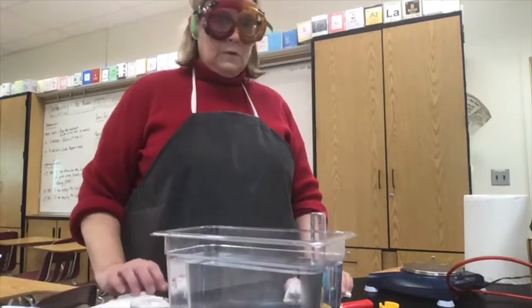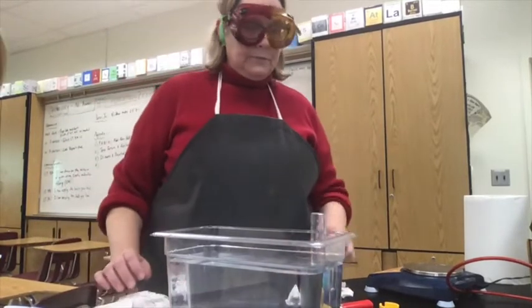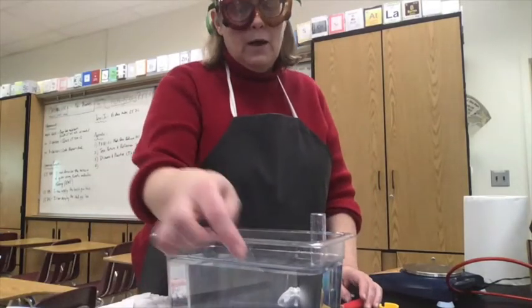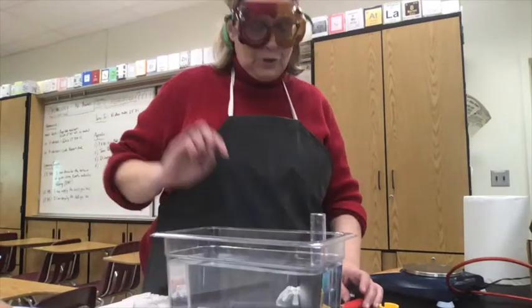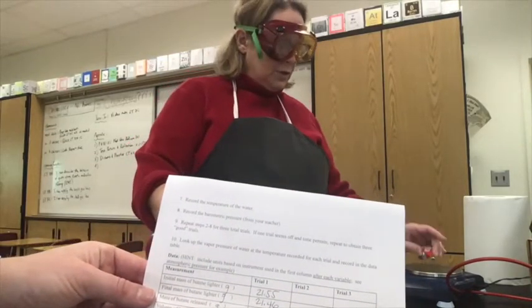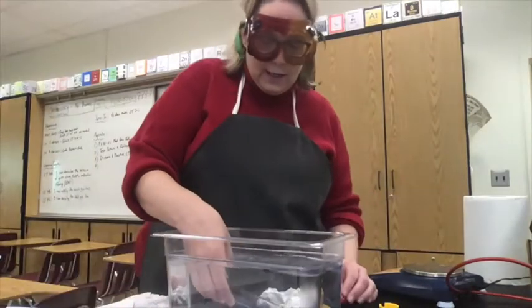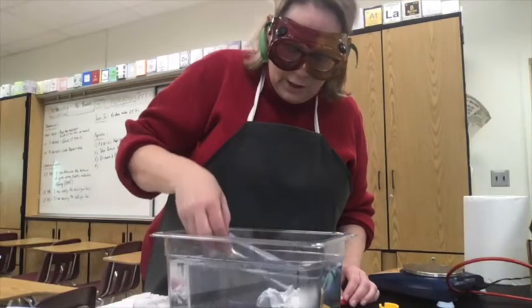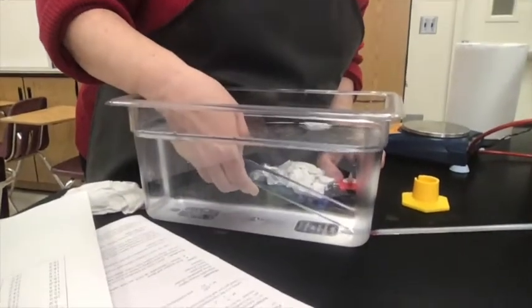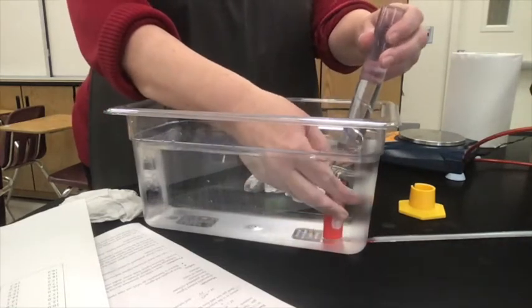Now we're going to do trials two and three with you, but this time we're going to make you write down the measurements — we're not going to be writing them on the data table for you. As a reminder: the final mass of the butane lighter from trial 1, which was 21.46 grams, can be your starting mass for trial 2. You don't need to remeasure it — the final mass becomes the new starting mass. Now I need to go back and fill the tube up and make sure there are no air bubbles.